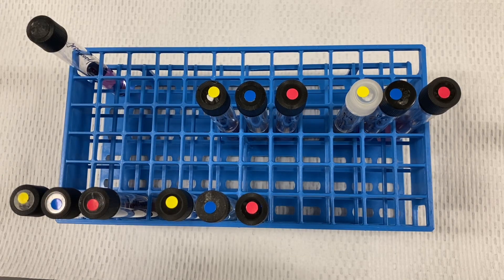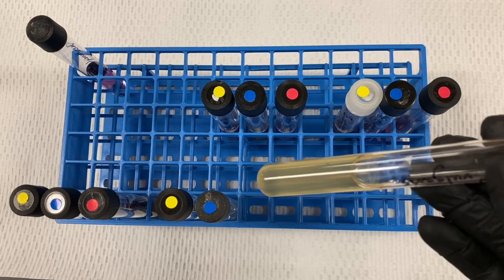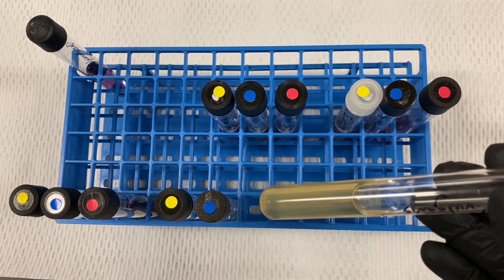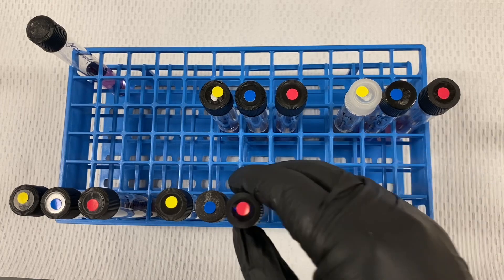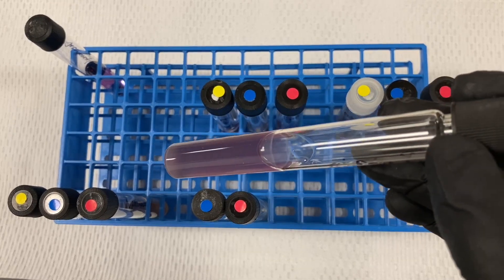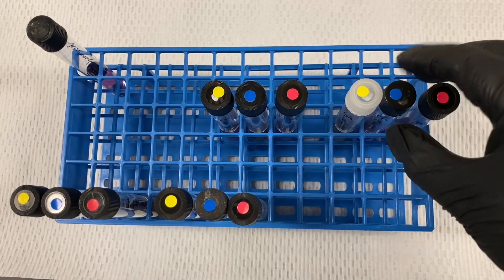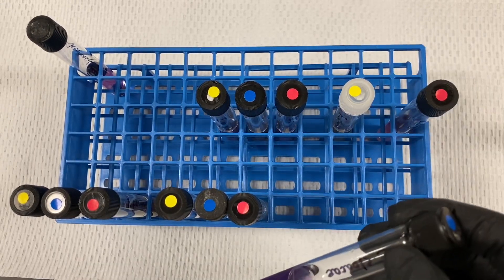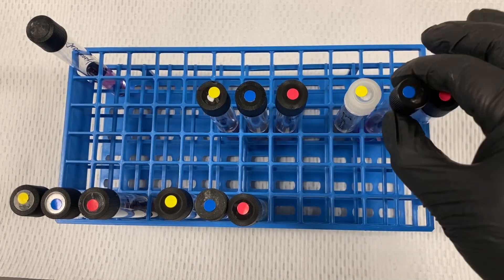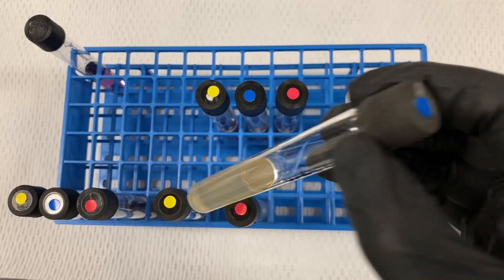If it can use the amino acid, it will remain close to this purple color; if it can't, it will turn brownish to yellow. For example, this ornithine clearly changed to yellow, so it's negative. For lysine, on the other hand, it kept its purple color, indicating a positive result. Different organisms will produce different results — for example, this arginine remained purple, meaning positive, but this other arginine turned yellow, so it's negative for that result.